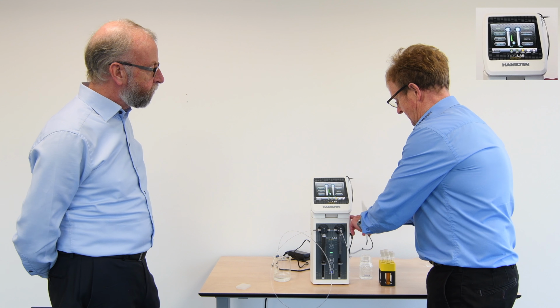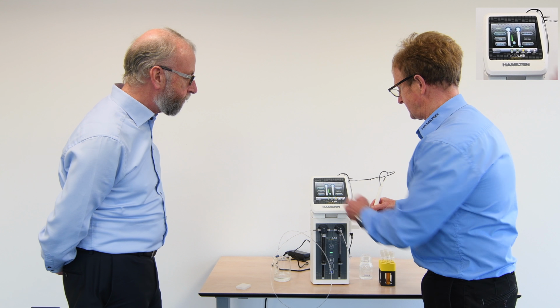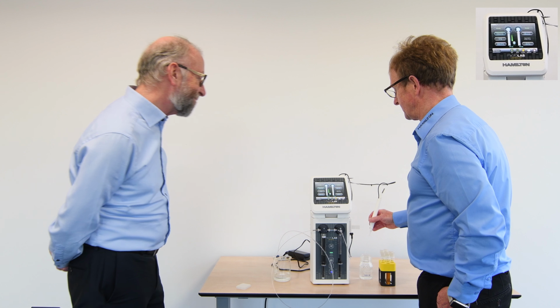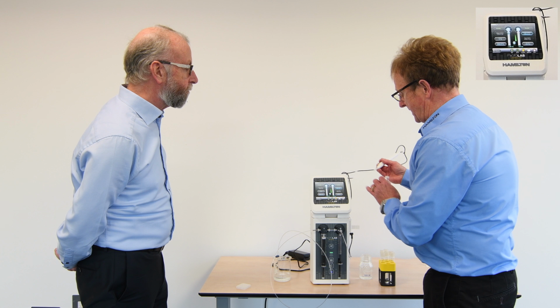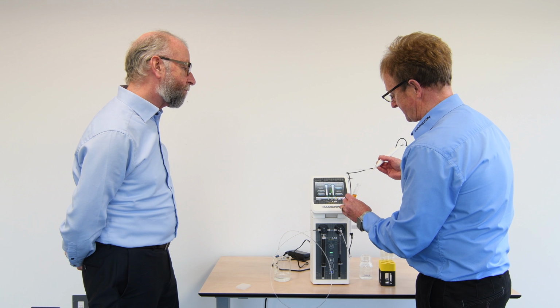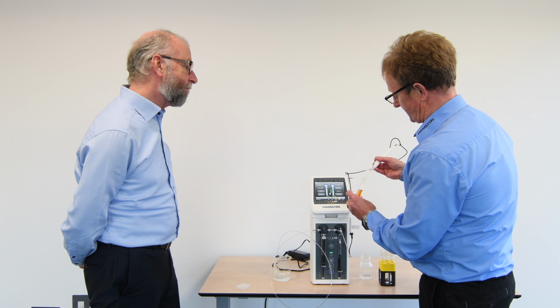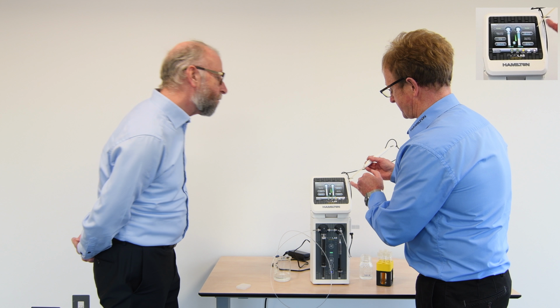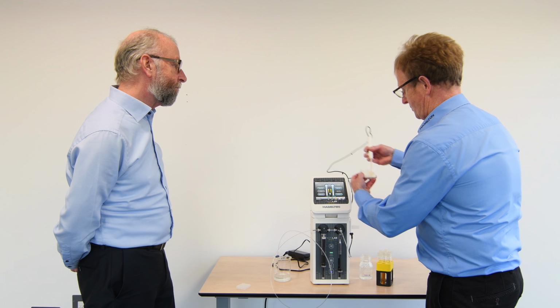So if we activate that program, again using the button on the hand probe, you'll see the first stage it's going to do is aspirate our diluent, which is taking up that 1500 microlitres. The next stage is it took up the amount of air gap, you see automatically here, and now it's going to pick up our sample here, 500 microlitres. Now we're still running with this particular program with an air gap mode, so the next button press is going to aspirate a small air gap. And I can now wipe my tip.